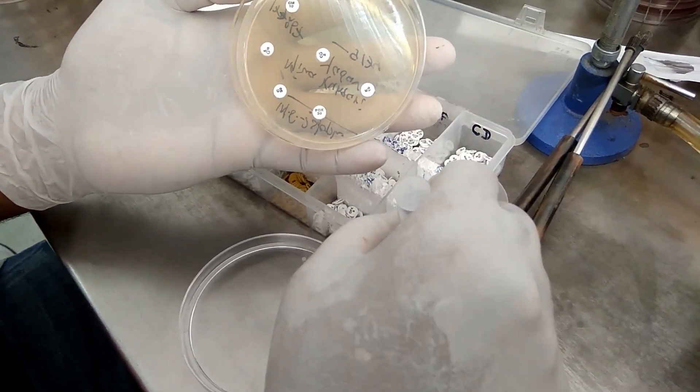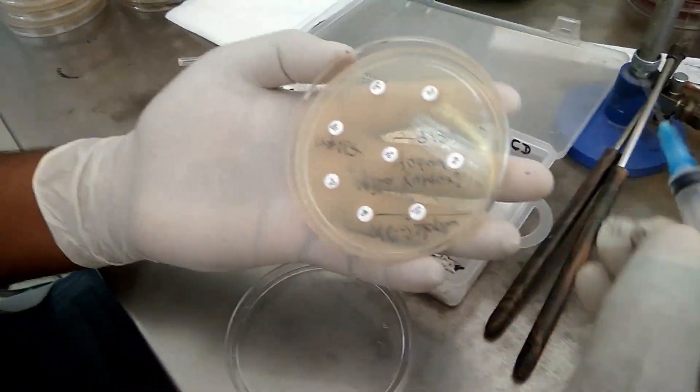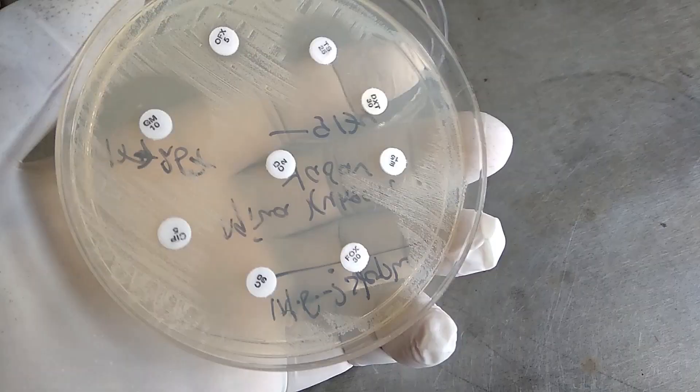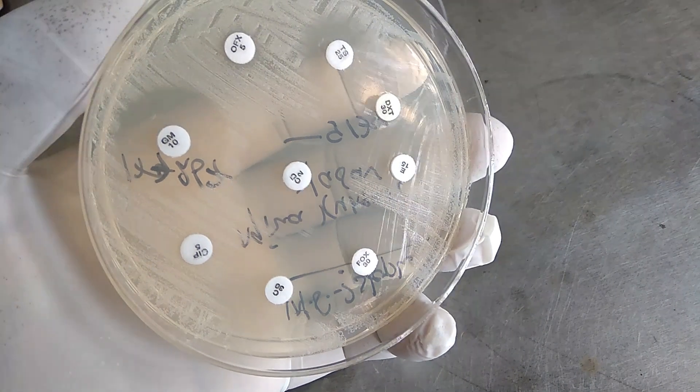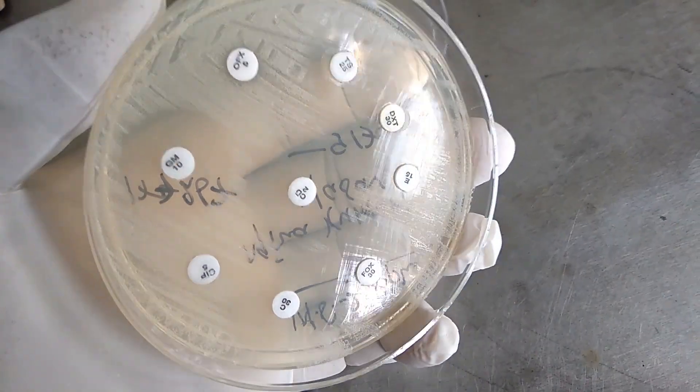The plate is then incubated at 37 degrees Celsius overnight to obtain bacterial colonies or bacterial growth.